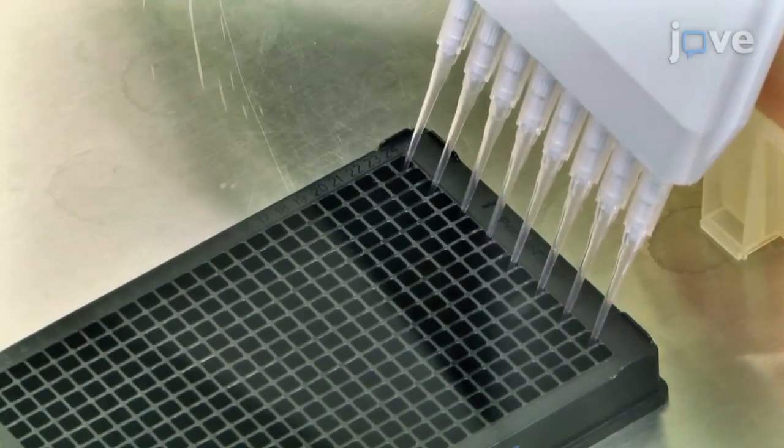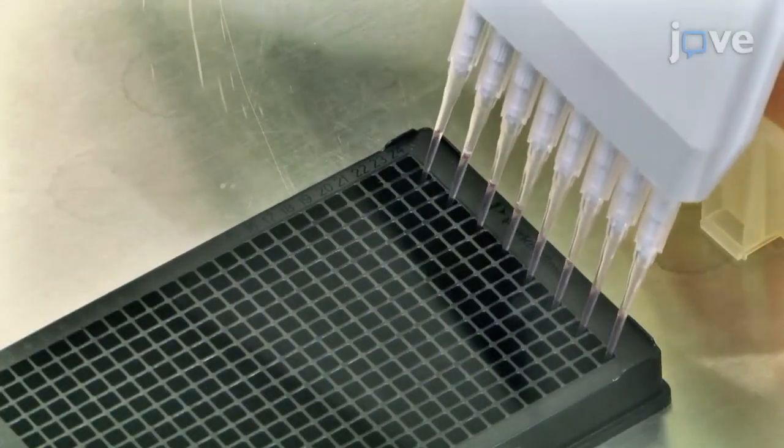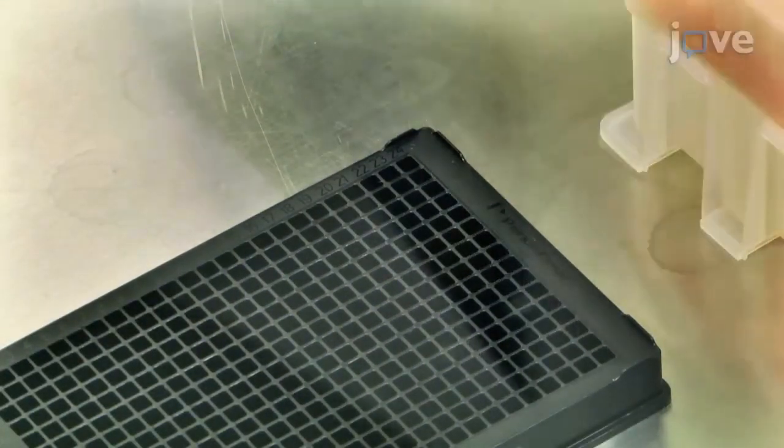This technique allows for a quick evaluation of drug pharmacodynamics aimed at rescuing the folding of disease-causing rhodopsin, thus accelerating the potential for a treatment for the currently untreatable blinding disease, retinitis pigmentosa.